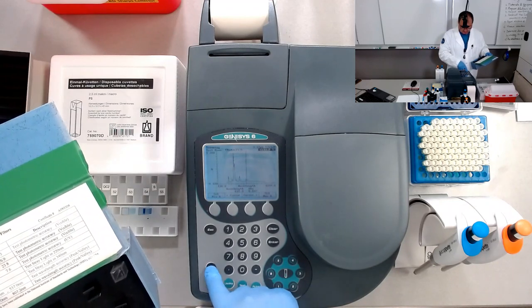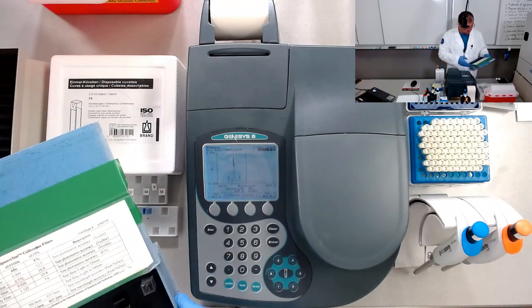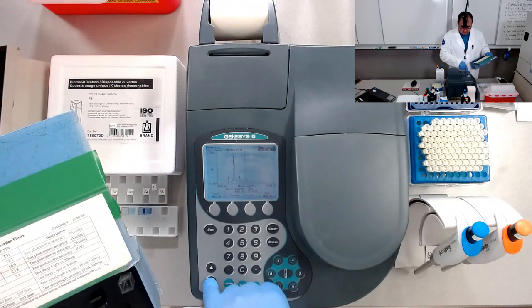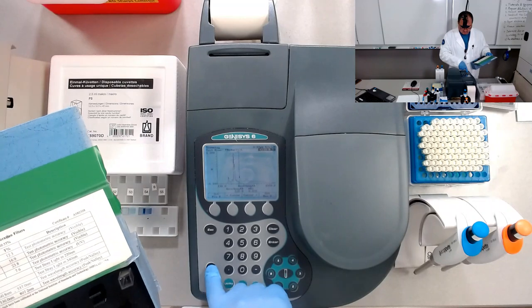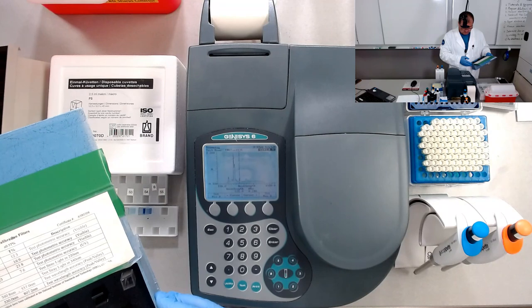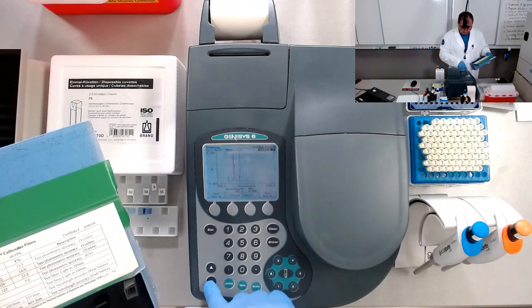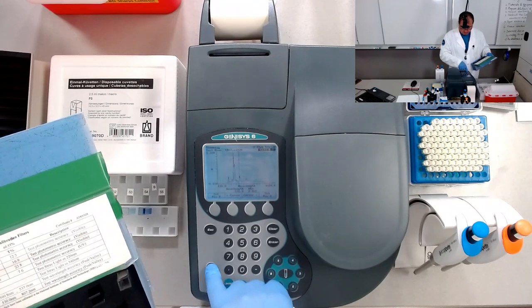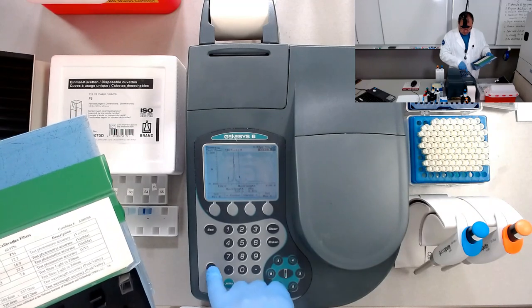So going in here we have 97, which is 640 nanometers. I don't have that lambda in my table. Let's look for this one. So 535 nanometers, you see. Okay, point 22, 21, 22, 21.